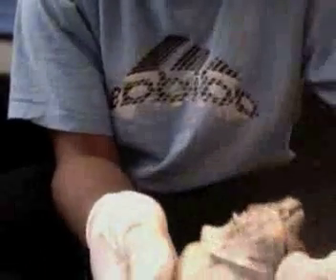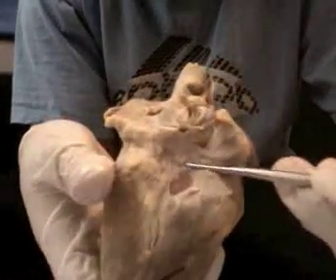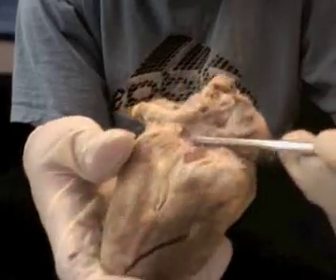On the back here, we have your coronary sinus. And that blood is deoxygenated and also eventually going to the right atrium.